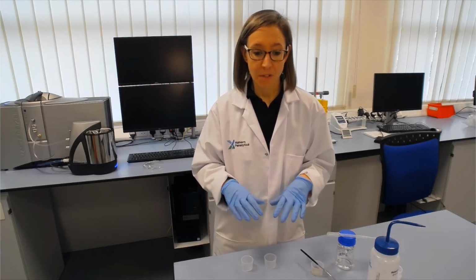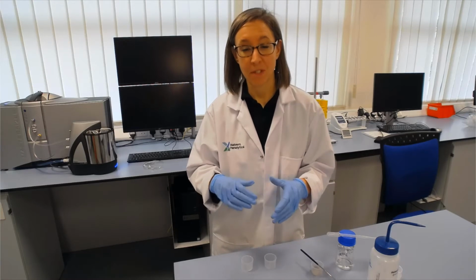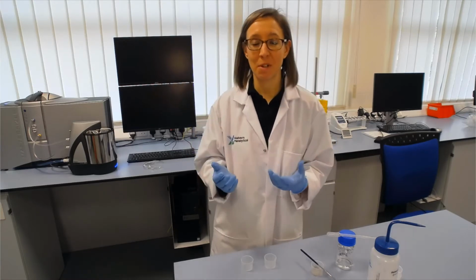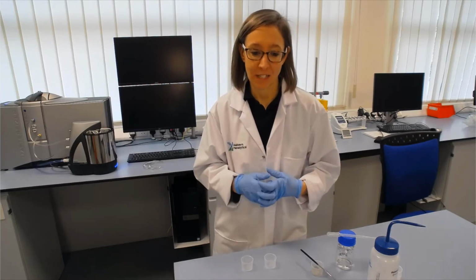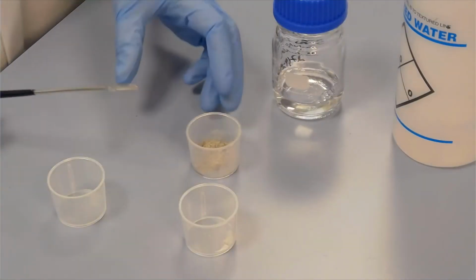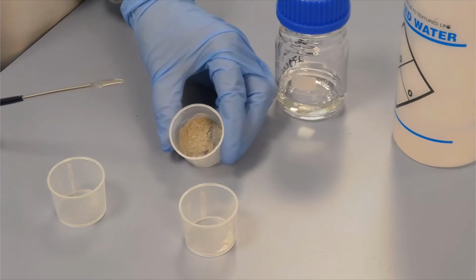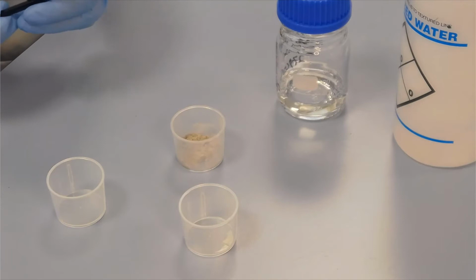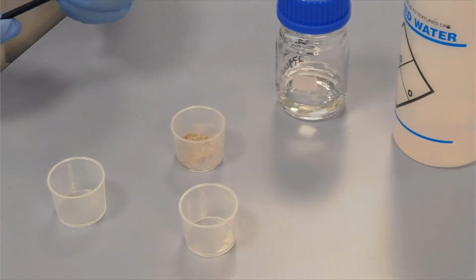Testing the dispersant on the sample in a beaker means that if it doesn't wet very well, then we haven't made a mess inside the dispersion unit, which will take a little bit longer to clean. In this case, we have a sample that's similar to a battery material. It's a silicon carbide sample. So what we're going to do first is that wetting test.